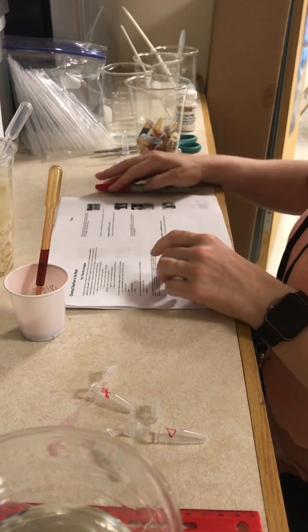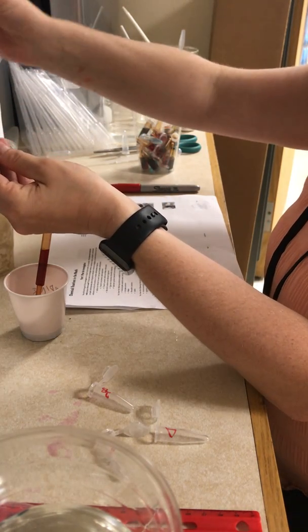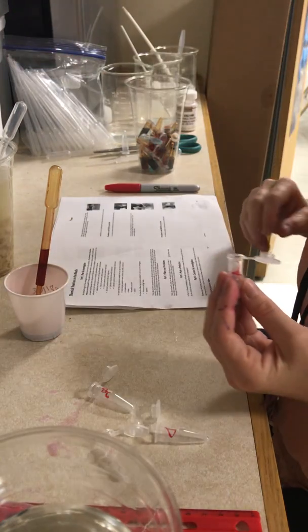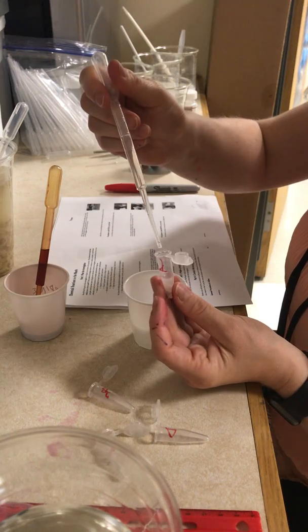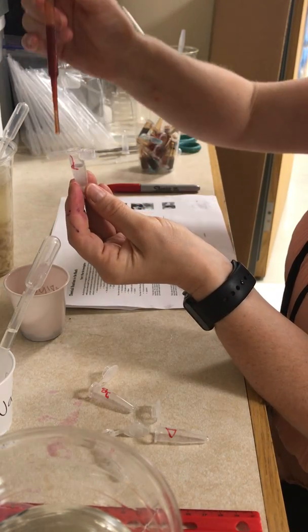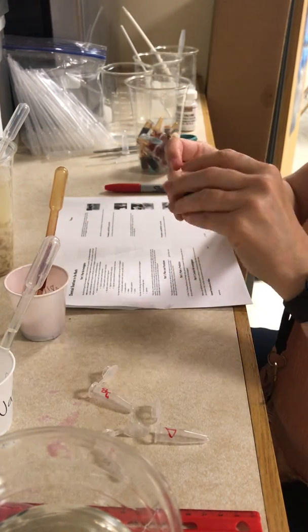I'm going to start with tube A. In tube A, I'm going to add my food sample — in this case, it's the crackers. I'm going to use my pipette to suck up some of the food and fill it up to 0.5 milliliters. Then I'm going to take my distilled water and add 0.5 milliliters, or five drops. And then I'm going to add five drops of iodine. I'm going to cap the tube.